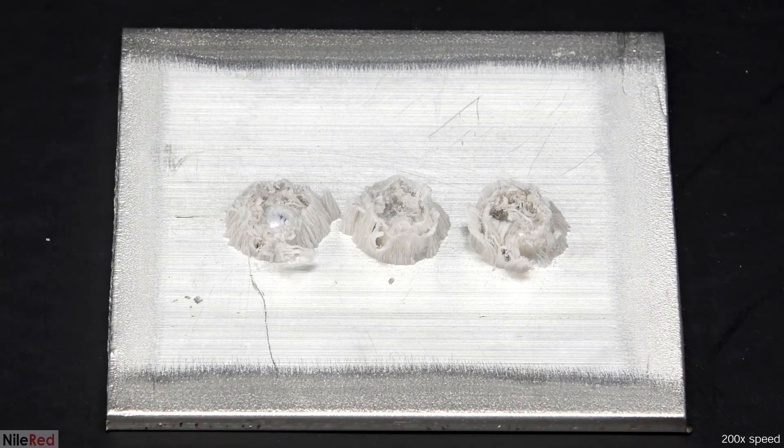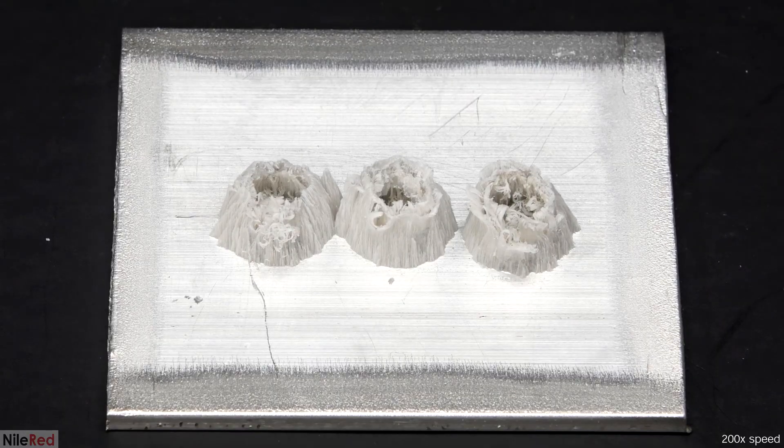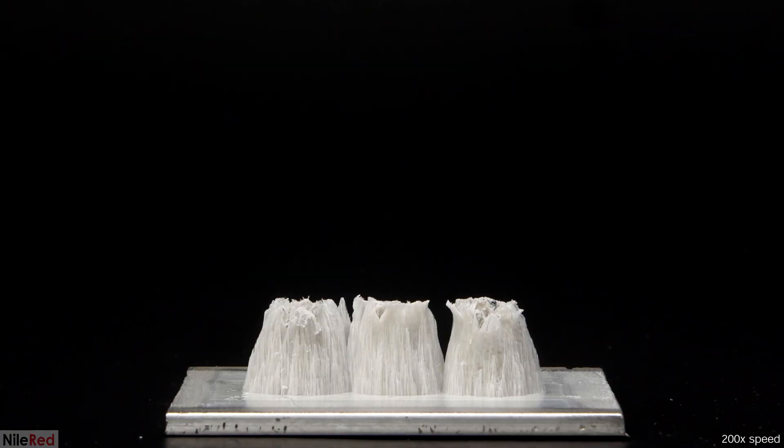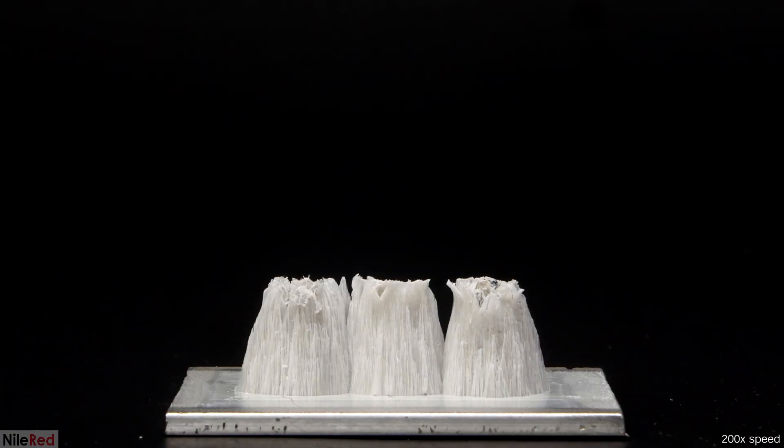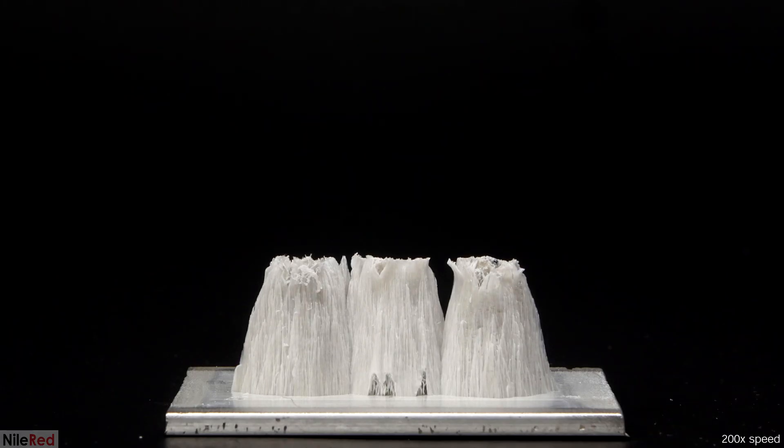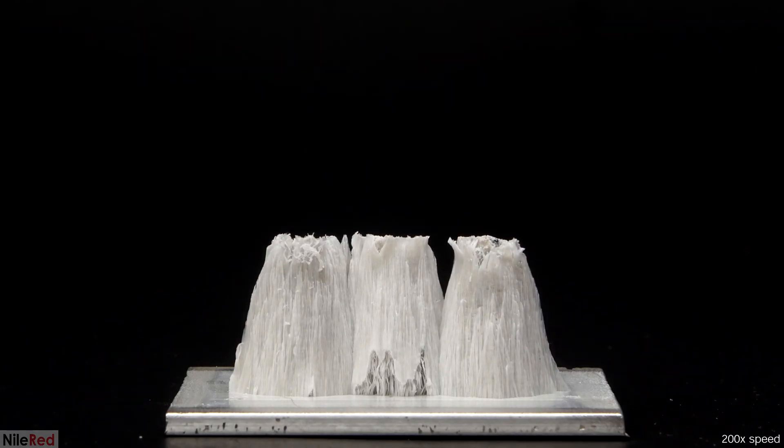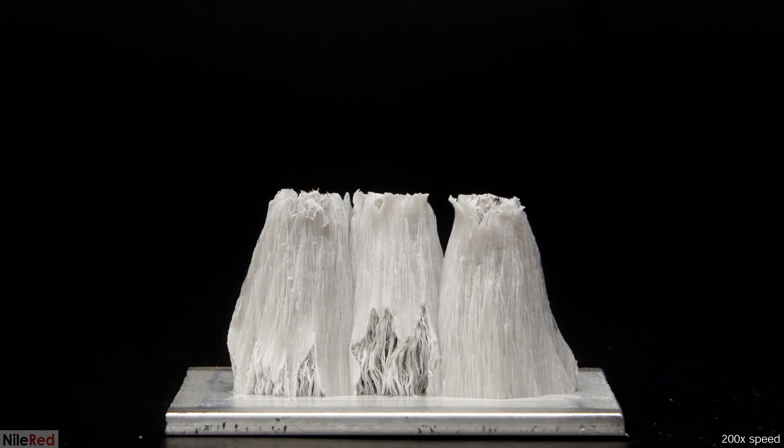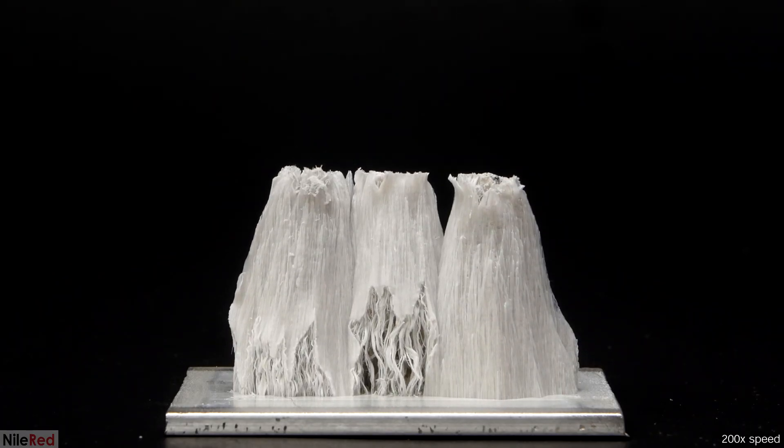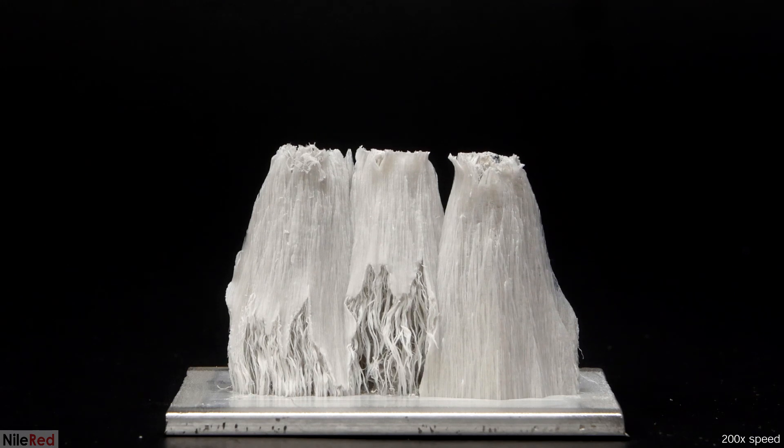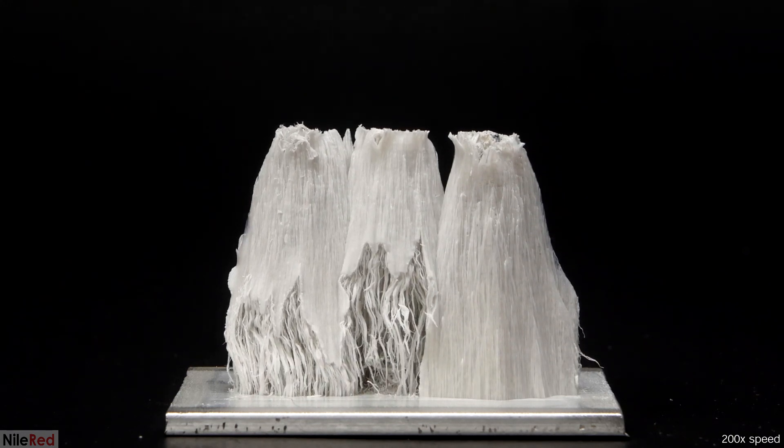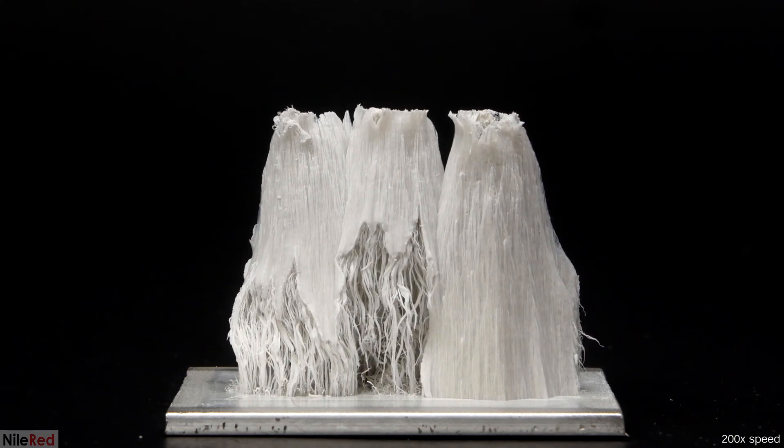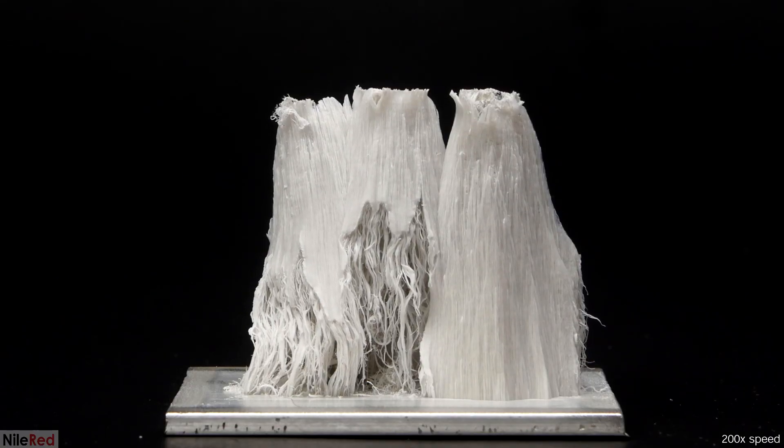The reaction starts very quickly, so I set up my time-lapse and I just wait for them to run into each other. In this run, for whatever reason the one on the middle and the left get weaker and weaker at the base. The one on the right seems to be a lot stronger and it holds the others up until eventually it's not able to anymore.